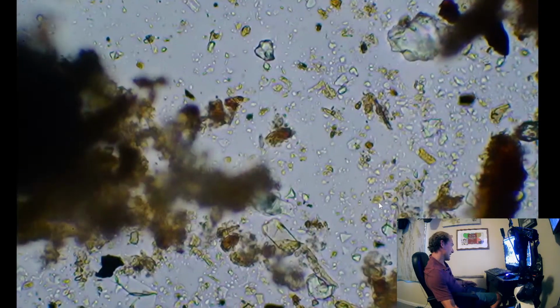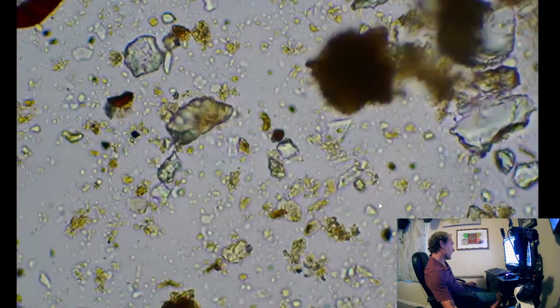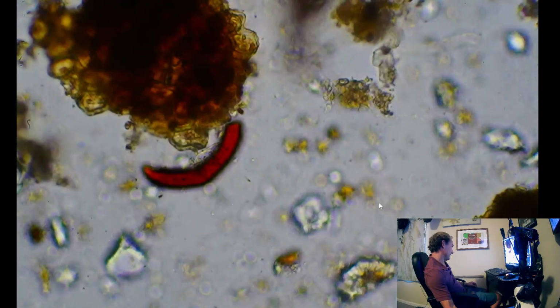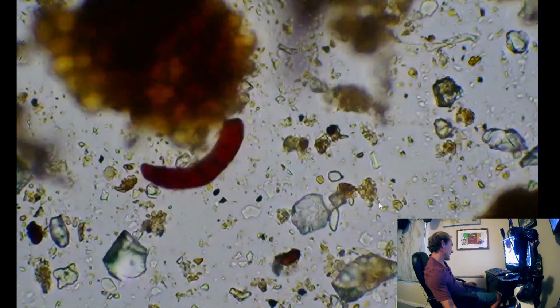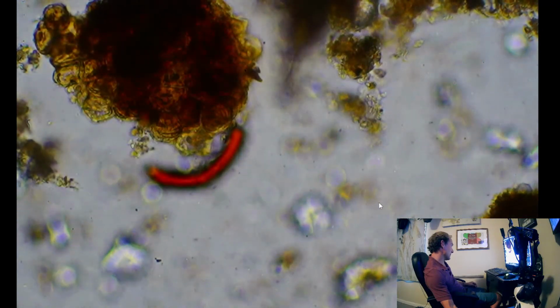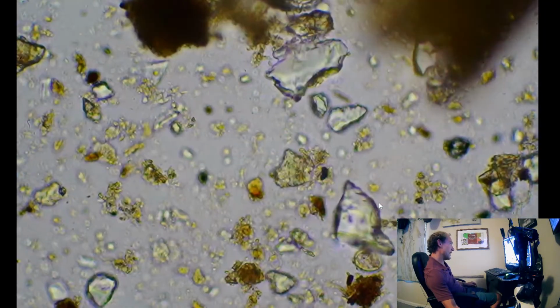What was that? Was that a diatom? No. The slide's drying up and pushing things together here. Wonder if that's plastic or some kind of weird spore. It's very glowy. But anyway.